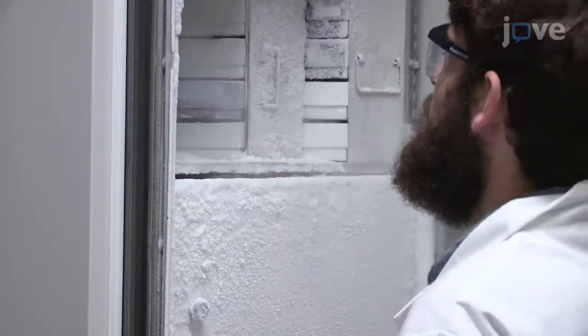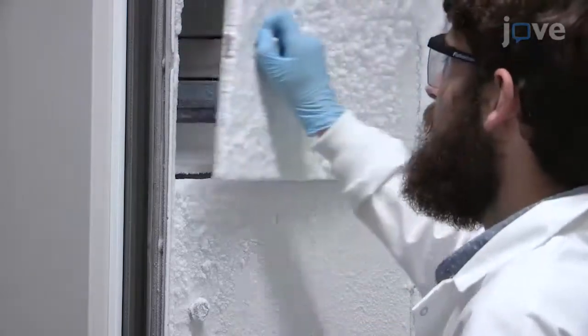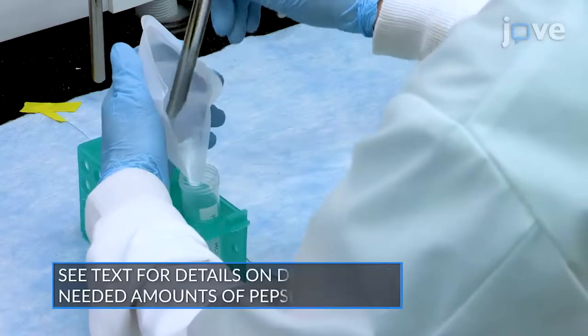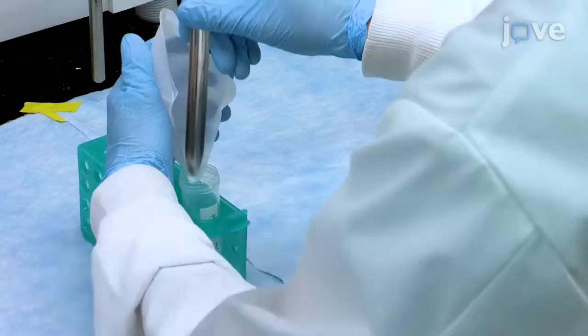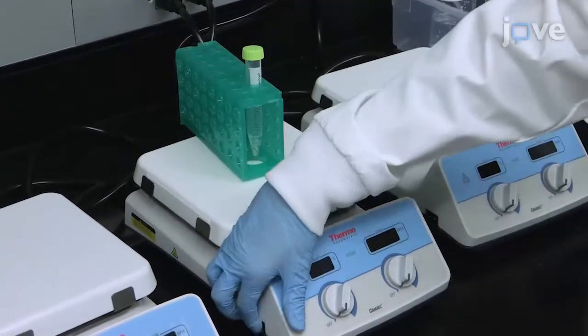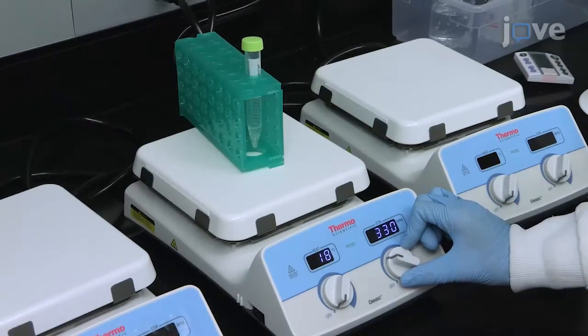To begin, remove the samples from the freezer and thaw at room temperature. While the samples are thawing, mix pepsin into hydrochloric acid to form a pepsin HCl solution. Next, add sample powder and the pepsin HCl solution to a 15 milliliter tube. Add a small stir bar and stir for 48 hours.